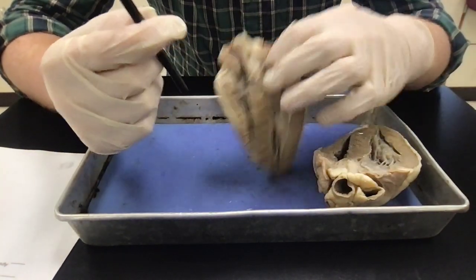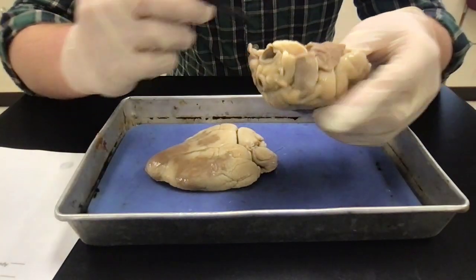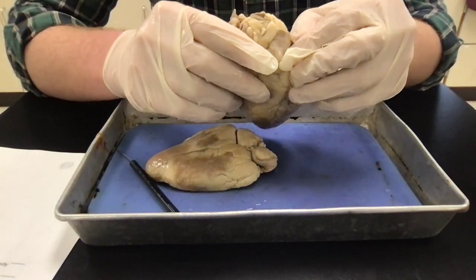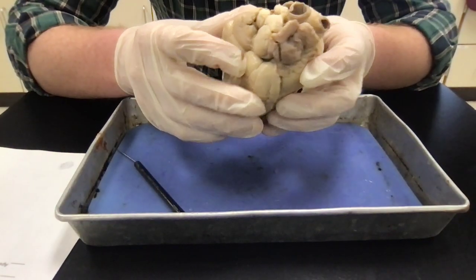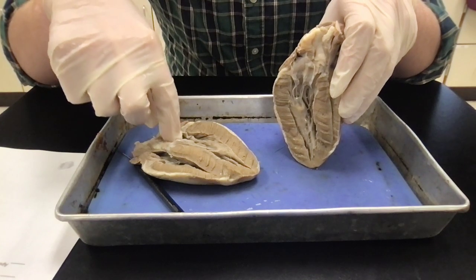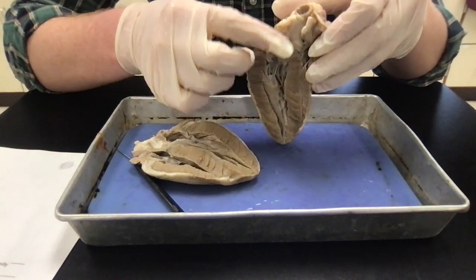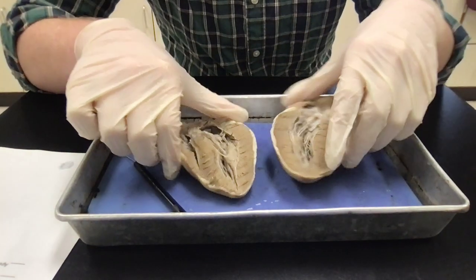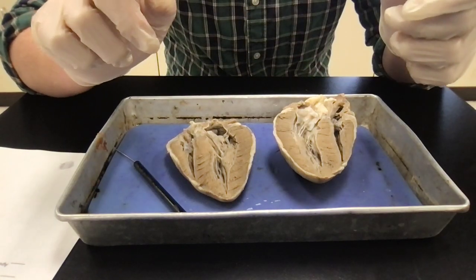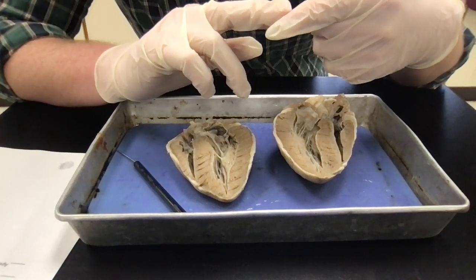And then the last one is the pulmonary vein, and that is going to be an opening that exists, and I think that one was cut, and that's going to be an opening on the left atrium, okay? So, yeah, I think this one was cut right about here. So just kind of know where the blood vessels attach to each chamber, okay? And then you do not have to know the aortic valve or the pulmonary valve for the test.